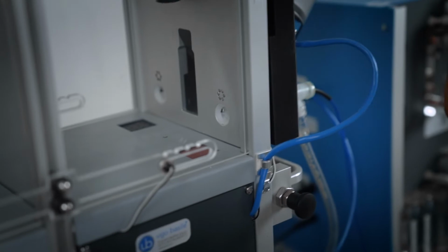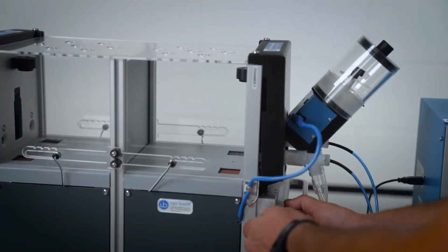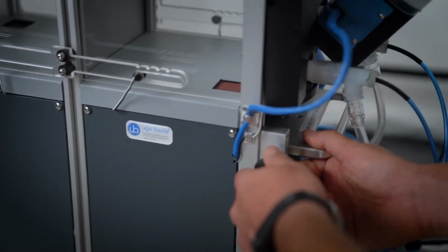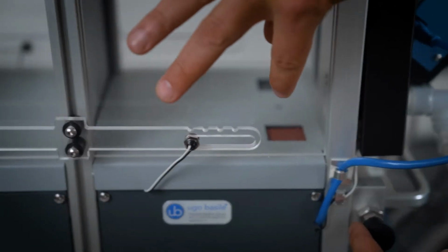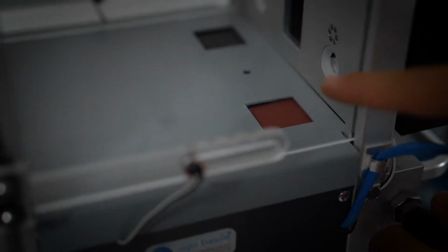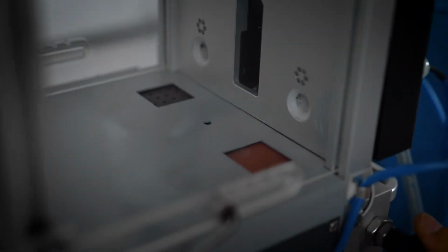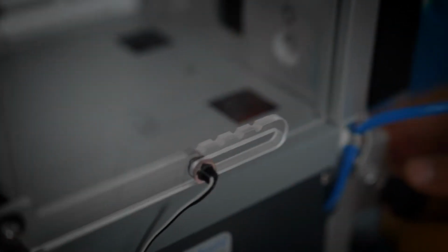Then, as we said, the other dimension is tactile. So as you can see from here, when the animal nose pokes, it will actually have to sit onto a texture, which we have in 6 different types that are very, very easy to change, as I will show you in a minute.